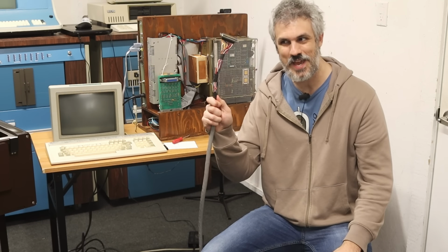I had a tremendous amount of trouble getting the RX and TX correct from the PDP-11 to the opto-isolator here. It literally took me like 2 hours today to do it, because every time I took it apart and put it back together, I somehow got it backwards. Like, I've been doing this for 5 years and I still get it wrong all the time, multiple times. Like, how can I be so bad at that? But I started looking it up, and I went back through my notes to see, did I get the RX and TX on the data cable correct?